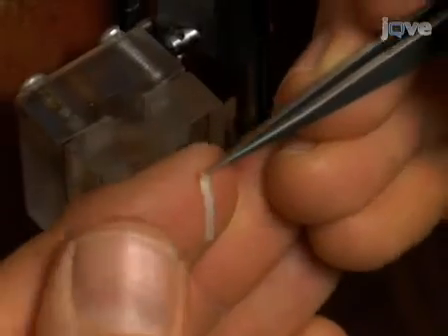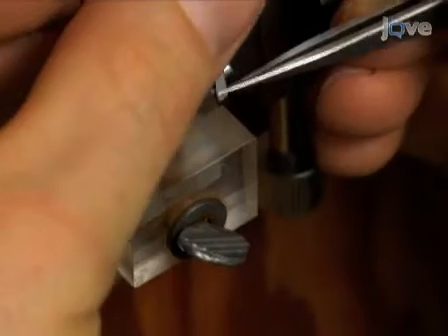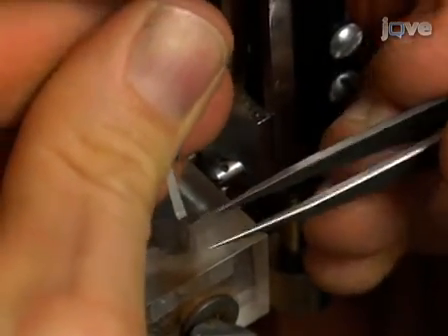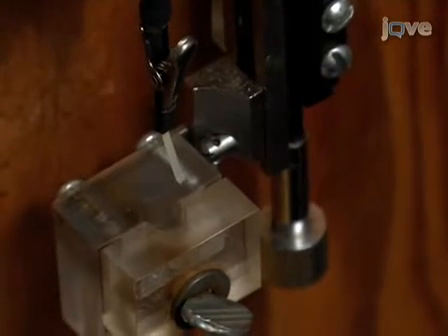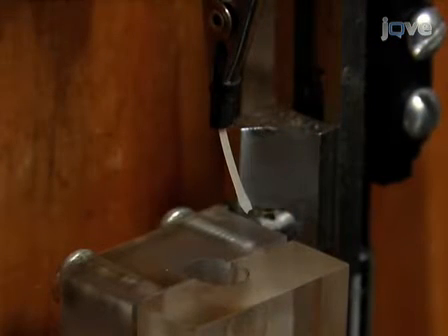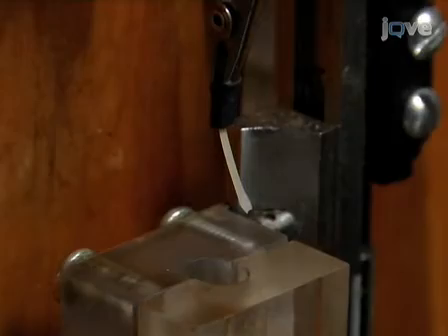To prepare samples for measurement of cell wall expansion, the basal end of the hypocotyl sample is picked up with fine forceps, and approximately 2 to 3 millimeters of the apical end is placed in between the open jaws of the movable clamp. This clamp is a spring-loaded alligator clamp. The metal jaws are coated with plastic to prevent direct contact between the metal surface and the buffer solution or the wall sample. In our experience, metal ions can leach from the clamp and inhibit the wall's ability to extend, and so we keep the metal covered.